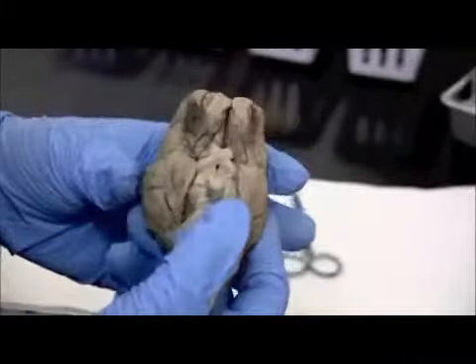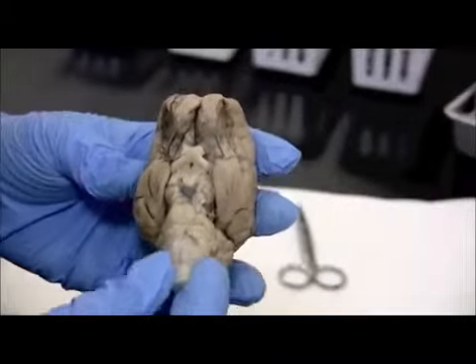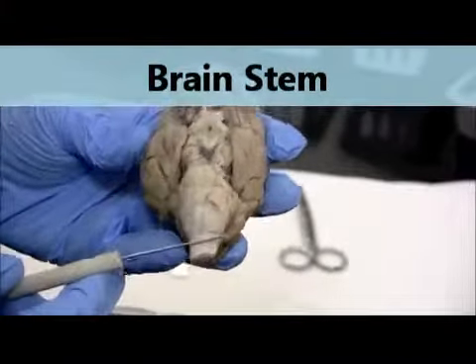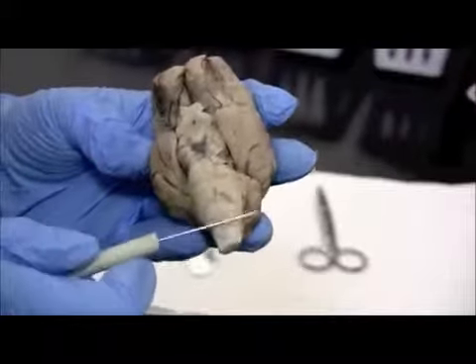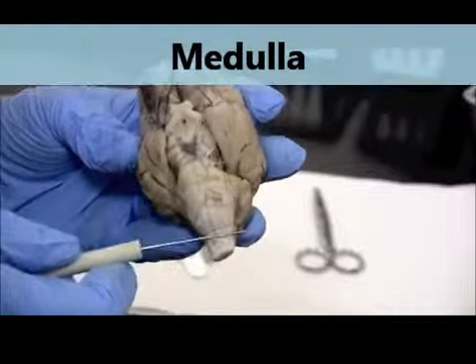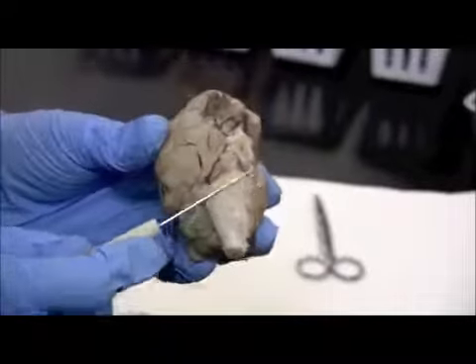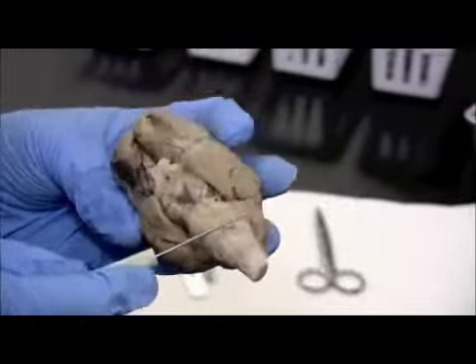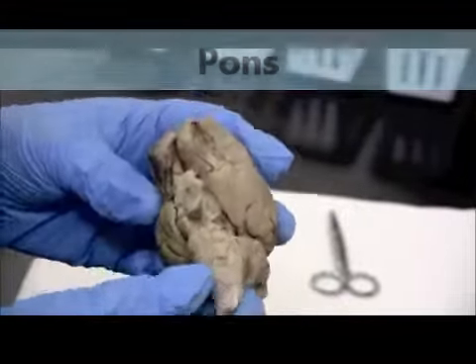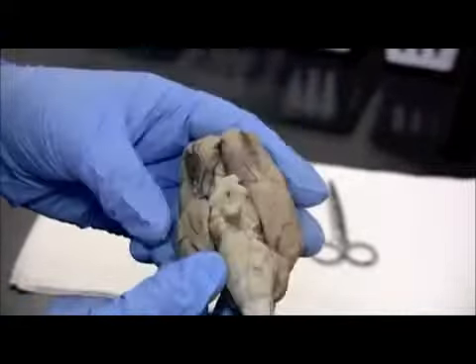Now we're going to look at the inferior side. This is the underside of the brain. And you can see the brain stem pretty well down here. It starts off with the spinal cord. And then when we get up to this first bump area right here, that's going to be the medulla oblongata. So we transition from the spinal cord to the medulla in this first poofing out. The second set of bumps right here is going to be the pons. Okay, so those are the two ventral parts of the brainstem, and then we've got the cerebellum right behind it.